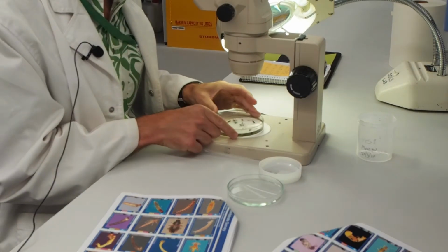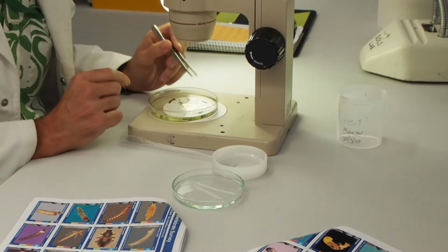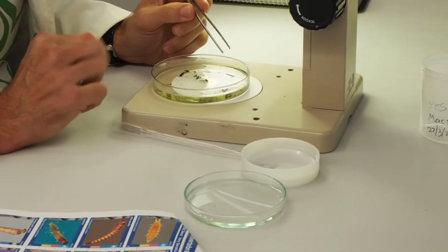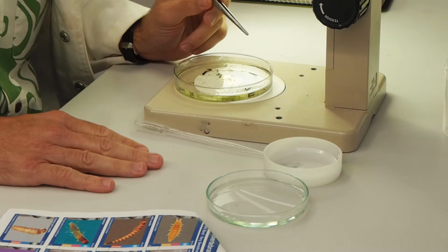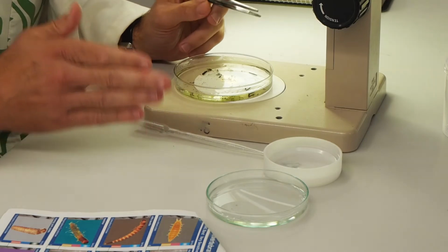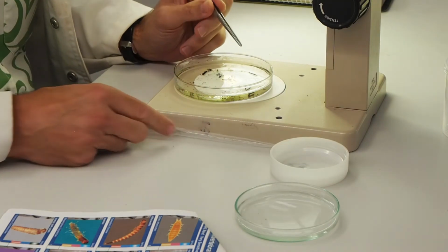All I'm going to be doing is picking out the groups and recording how many there are in each of those taxonomic groups, and then we'll send you the photos and you have to identify what family they belong to. Remember, you're going to have to record the class and family, but we'll give you a bit more detail of that in coming lectures.